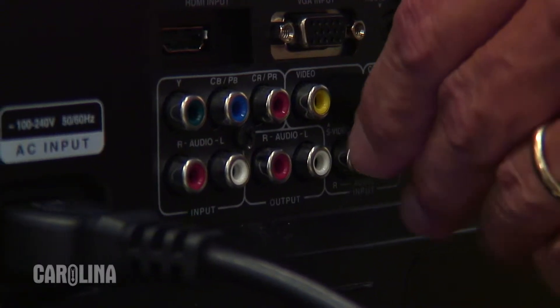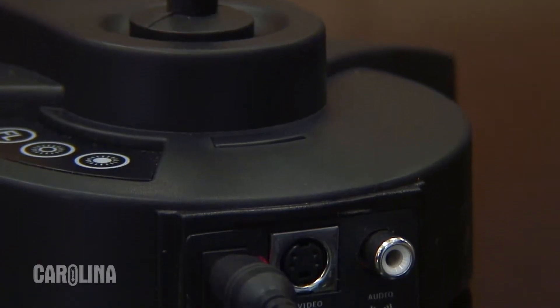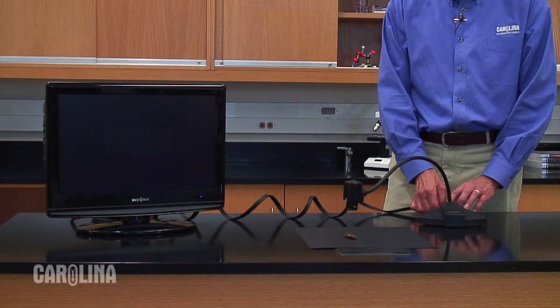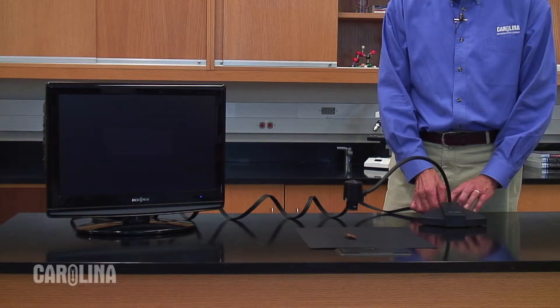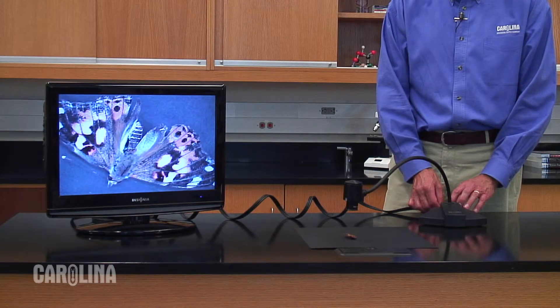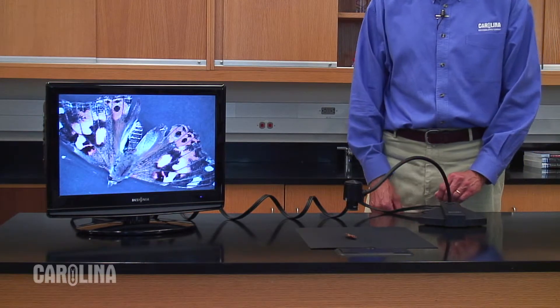Then connect the camera to a TV using the included S-video or composite video adapters to display the images. The magnified object will then appear on the TV screen so that your entire class can see it.